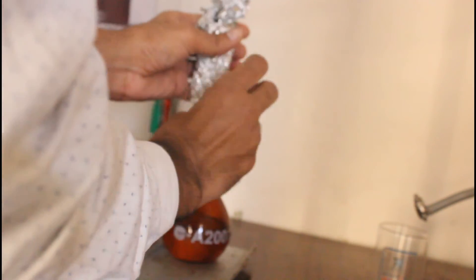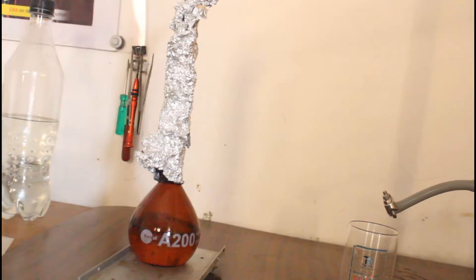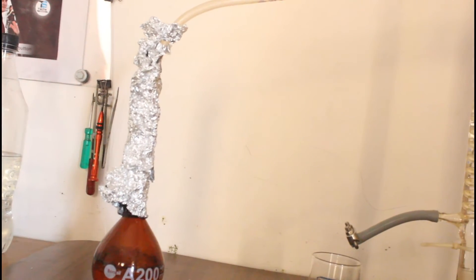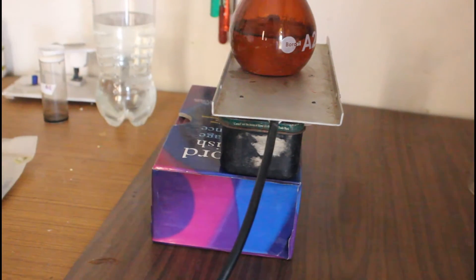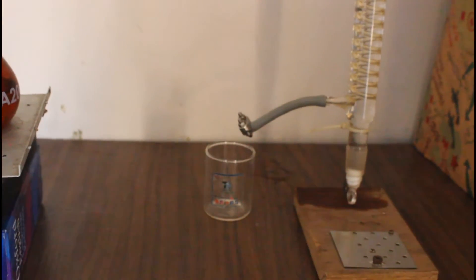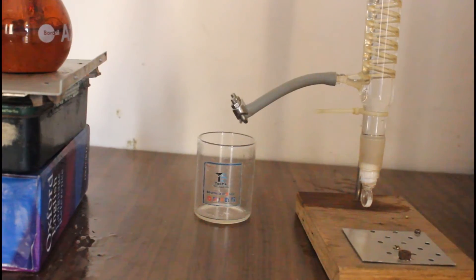So I'm going to place this aluminum foil around the neck of this bottle so that the temperature remains high and the condensation breaks up. And also I have increased the height so that the liquid can flow towards this condensation tube or the distillation tube.